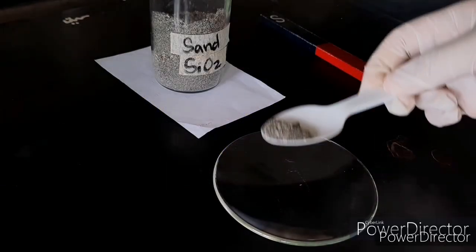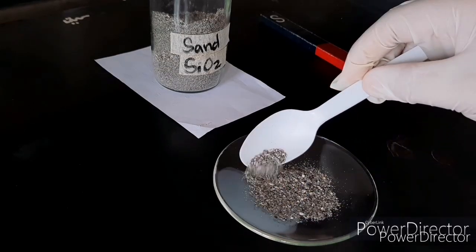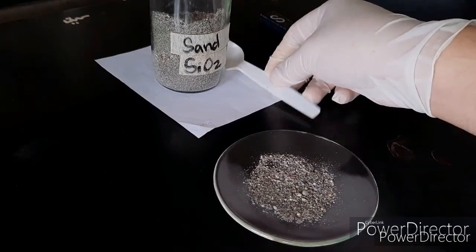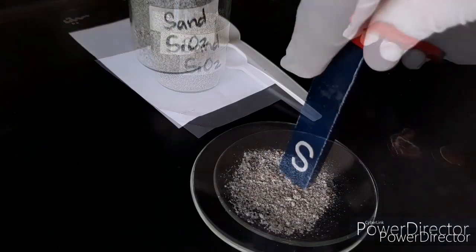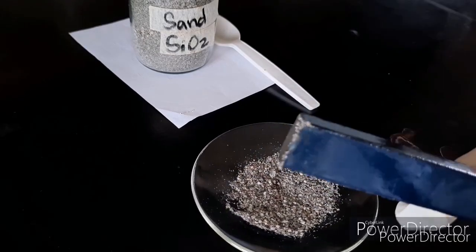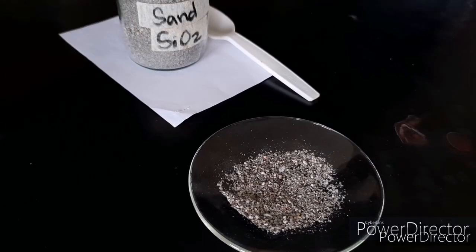Place a magnet over a mixture of black sand on a watch glass. Then, observe what happens as the magnet is placed closer to the sand. First question, can you identify what sticks to the magnet? What remains on the watch glass?